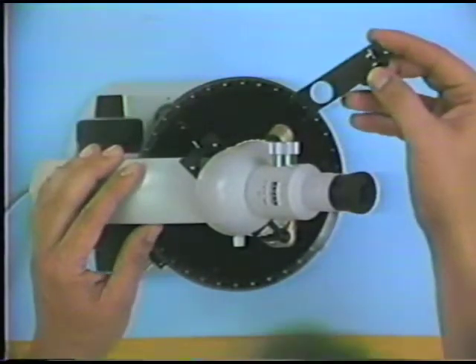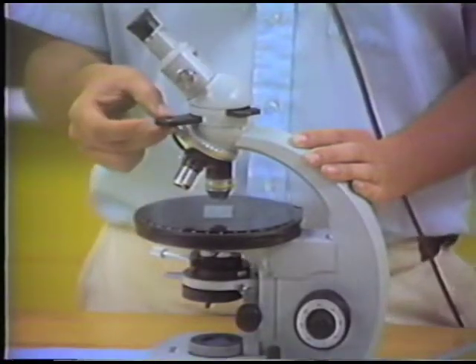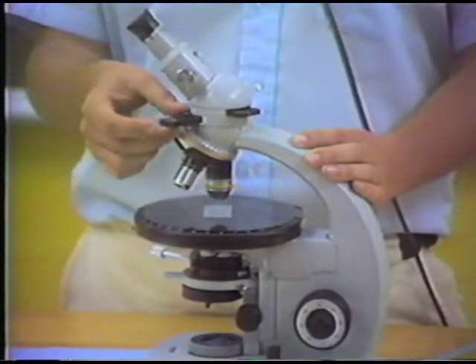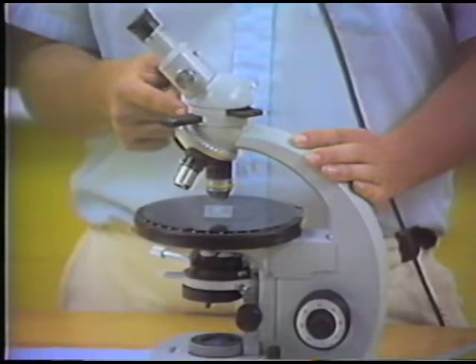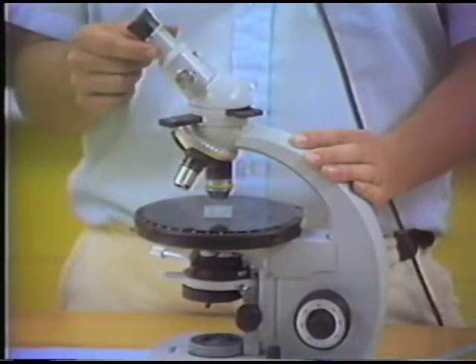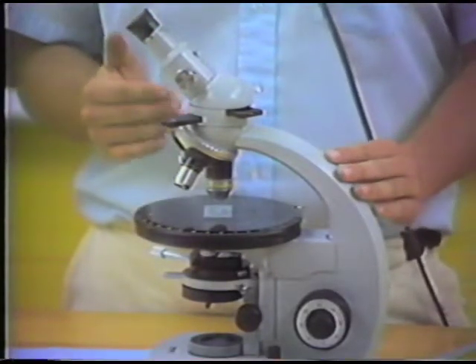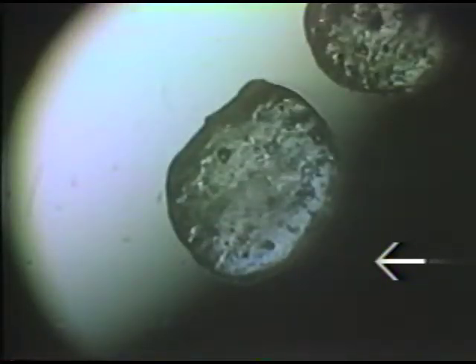And because we don't put it in the accessory slot all the way, I'm going to slide it in the slot like here, just enough so that the leading edge of the accessory plate blocks the normal path of light that's coming up through the tube. If we look now at the specimen, you can see that part of the field of view of the specimen has become dark. And the way we apply the oblique illumination test is to observe the shadowing on the mineral grains.